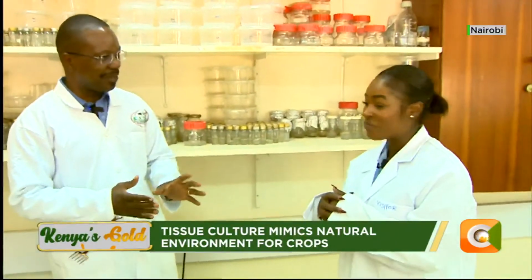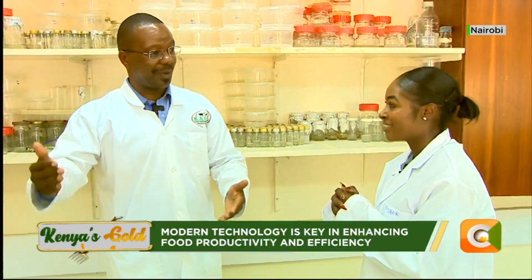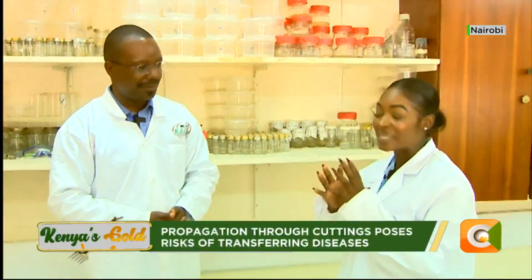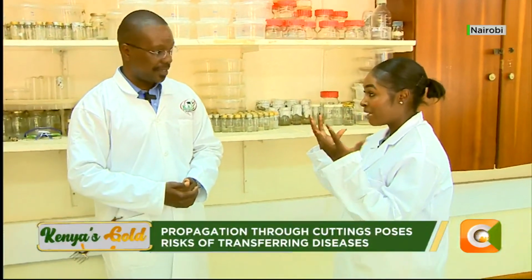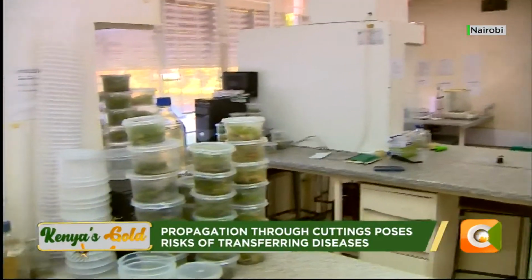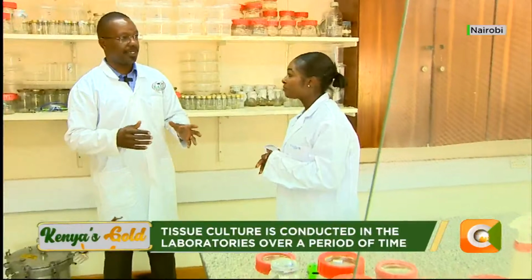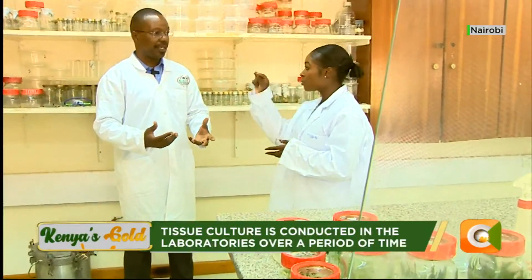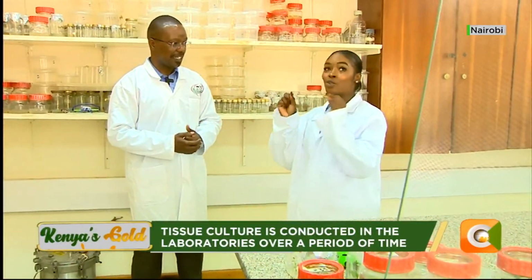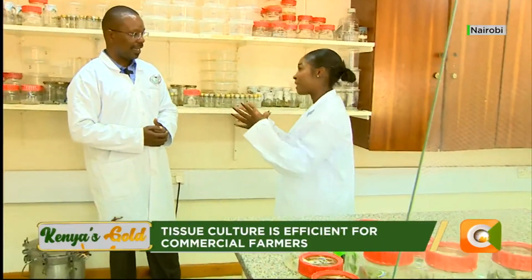Yes. You optimize today, you put 1 ml, it doesn't work. Tomorrow you put either more or less until things work. And this process happens entirely in a lab, like the place we are in right now. The place we are in is well equipped in terms of equipment. It has the conditions that are right. Talk to me about those conditions. Which ones do I need to meet in this lab so that I make sure this process of tissue culture is seamless all through?